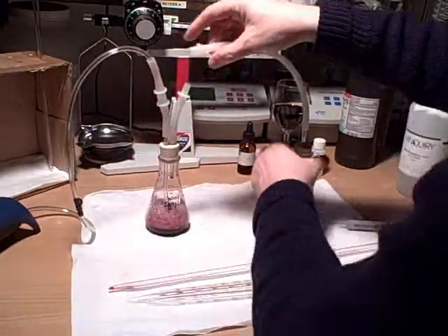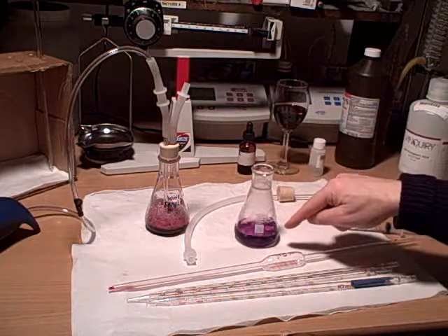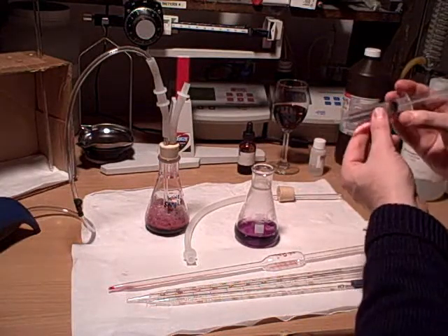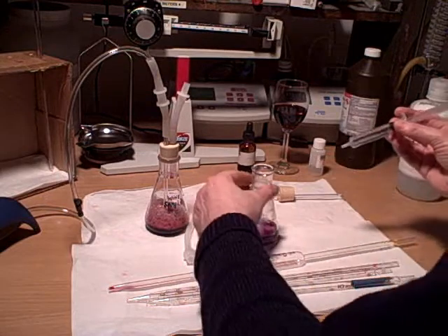Disconnect up here — makes it easier and less floppy. Pull this out here. So all that's left to do now is to go ahead and titrate this back to our gray-green or green color, depending on which one we started with. I have my syringe at 10 mils, that way it's very easy to tell how many mils were used when we do our math afterwards.